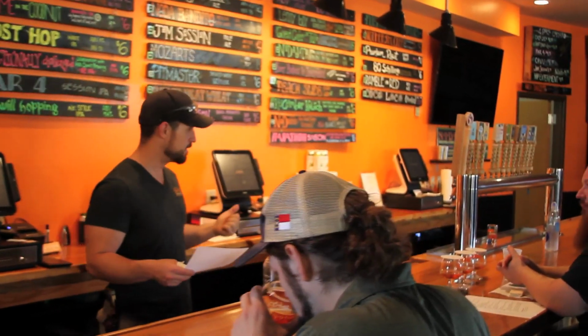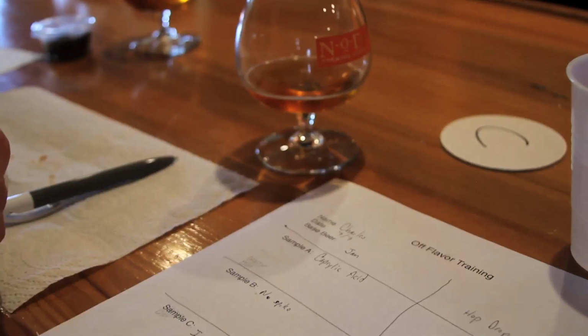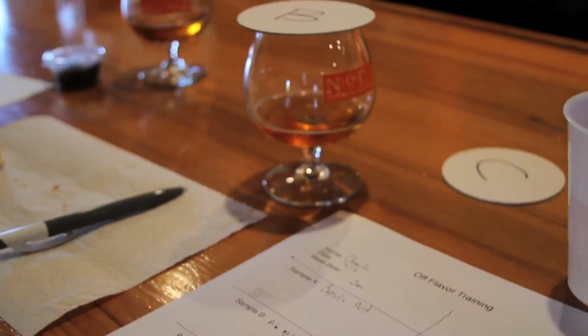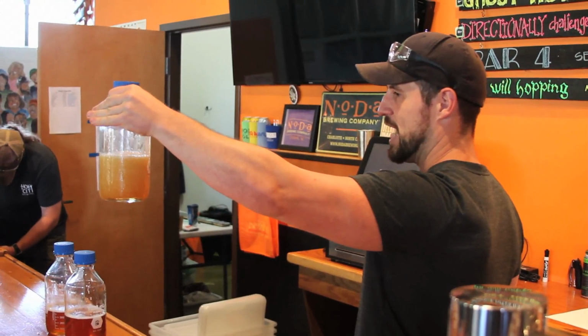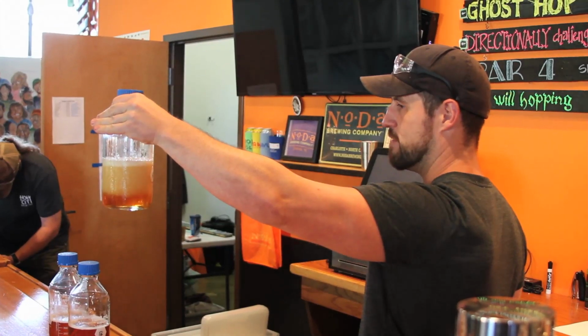Another thing that we like to do with it as well is if we want to change any sort of a process or add a different brand of a certain hop or a malt or whatever, we want to use it as a testing ground to basically compare the same batches using prior ingredients to see if there was a noticeable difference, a favorable difference, or a negative difference, and basically make a call on whether we're going to continue using that ingredient or not, because as many of you know, most of the stuff that goes into our beer is an organic material and they change year to year, crop to crop, etc.